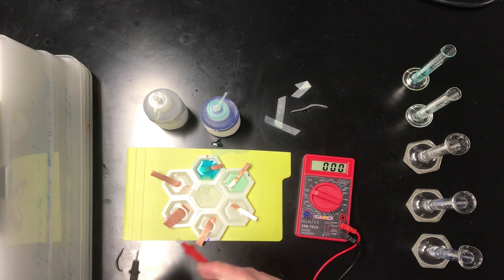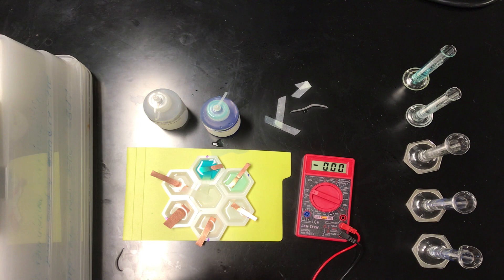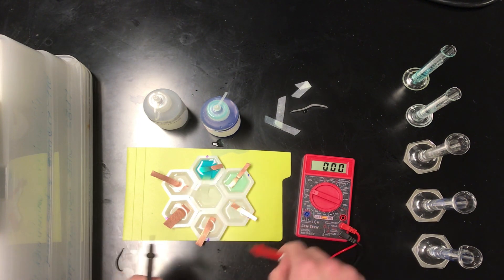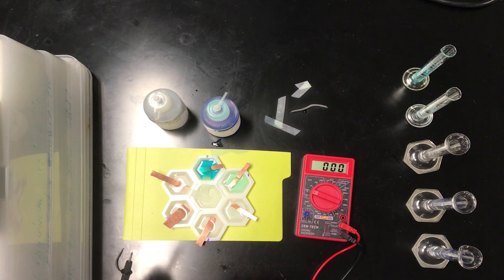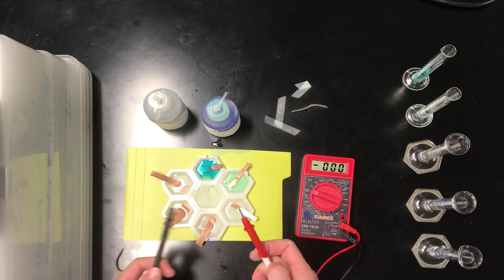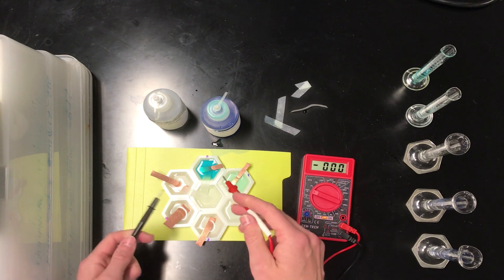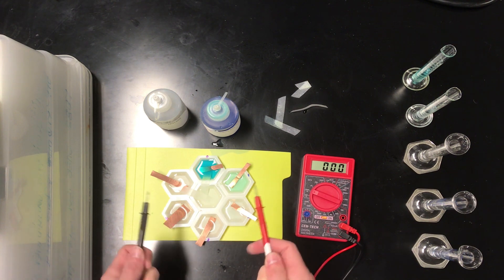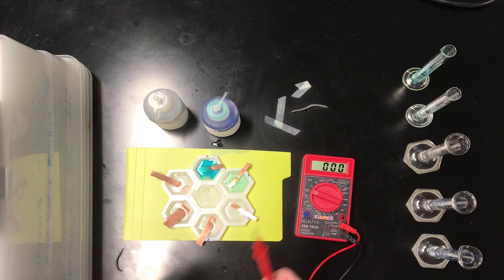So I'll give you some data to actually work up the results of this experiment, but in essence, the thing we should notice is that the voltage is changing as we adjust the concentration of copper ions in the, I guess we would call it anode half cell. And all of the more dilute solutions are the anode. And that makes sense from a fundamental thermodynamic point of view, if you think this through.